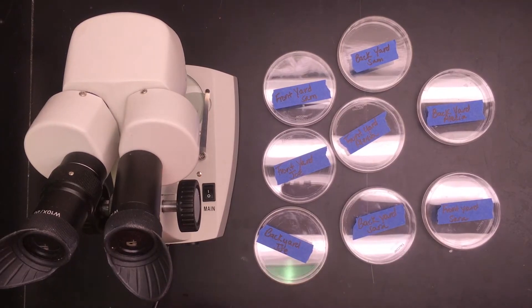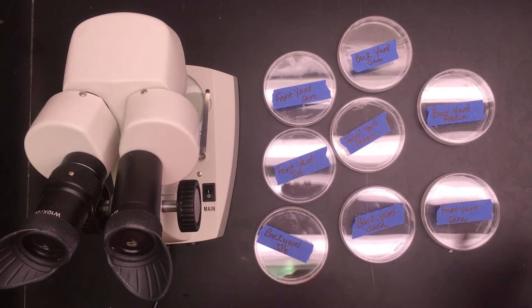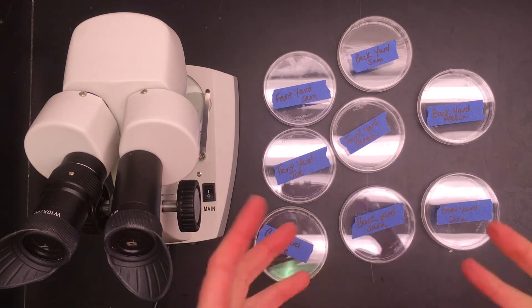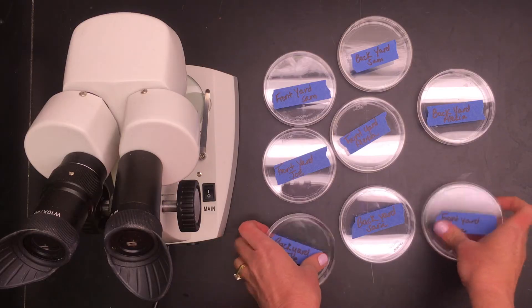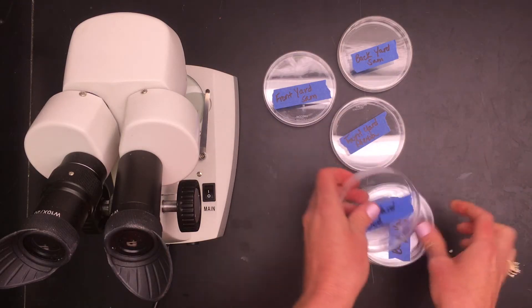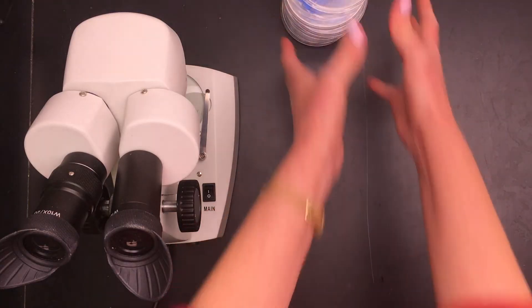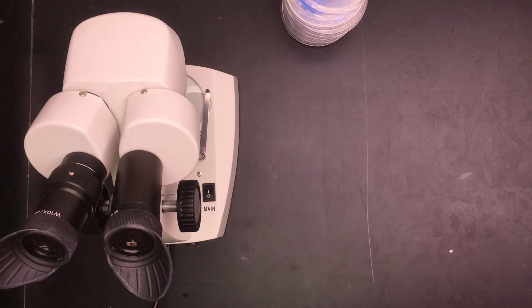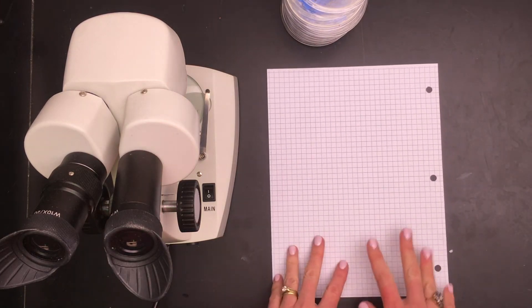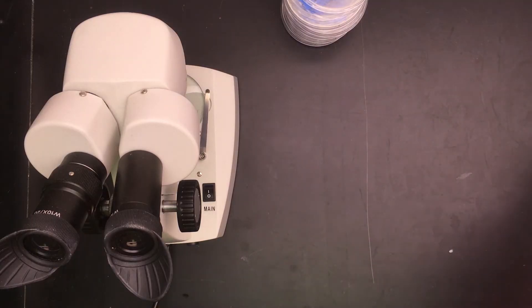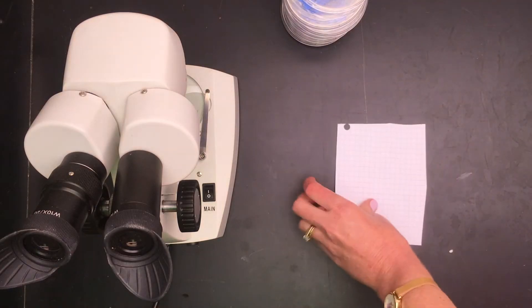Once your group has exposed all of your dishes and you've brought them back to lab to count your data, I'm gonna show you one method that you can count your data. One thing that you need to be aware of is you need to be consistent on your data.